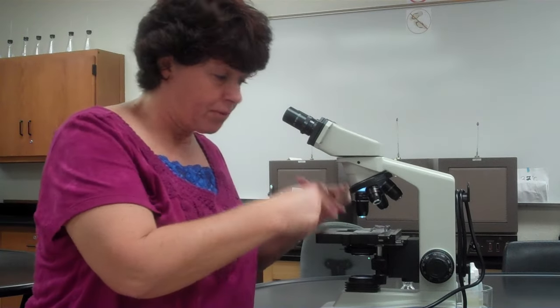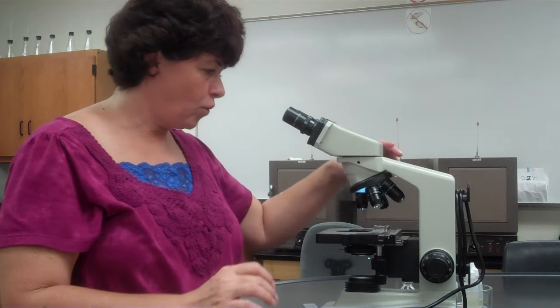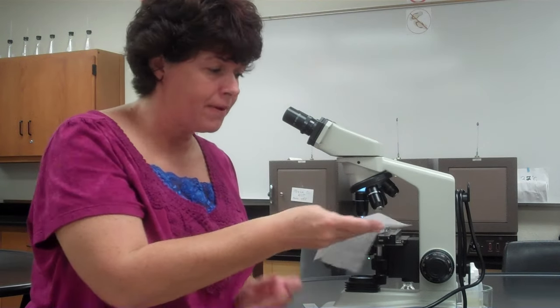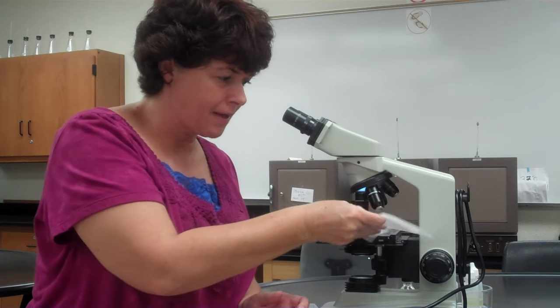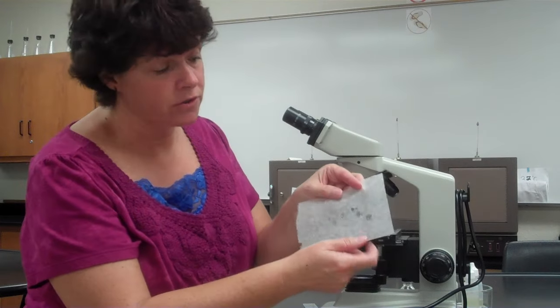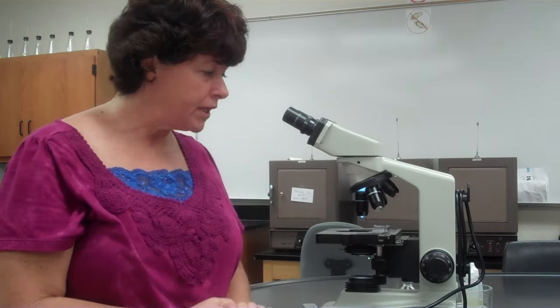Now that I'm done — I found my specimens and completed my drawing — I'm going to wrap up. The slide was at 100x, so go to a lower power, lower the stage, and remove your slide. To clean the oil off the 100x lens, use lens paper only — not a paper towel, not a chem wipe. Very gently dab the lens with the paper; do not rub. Keep dabbing to a dry spot until no oil comes off. When nothing comes off, you're done — don't use any liquid to clean it.